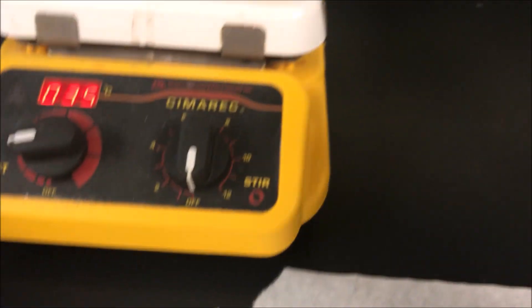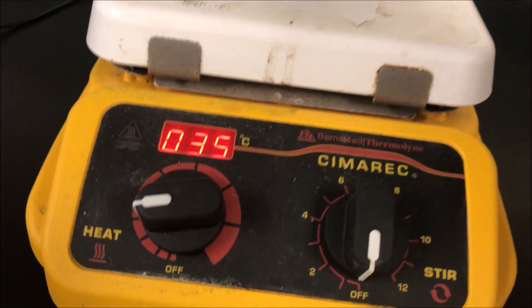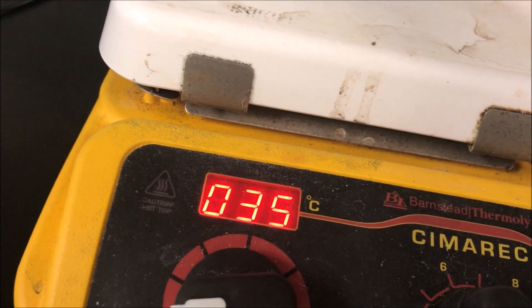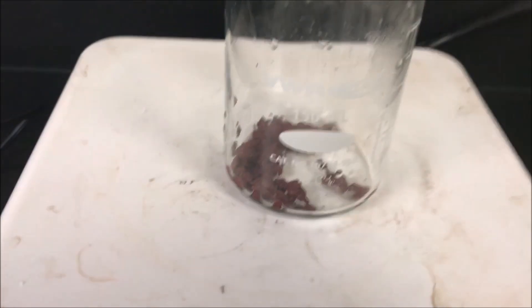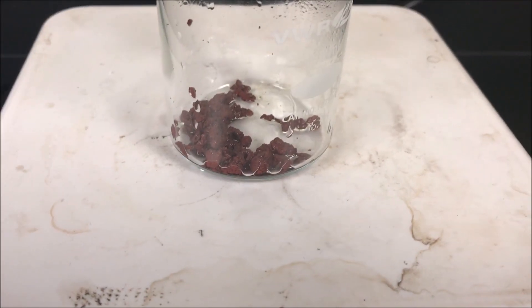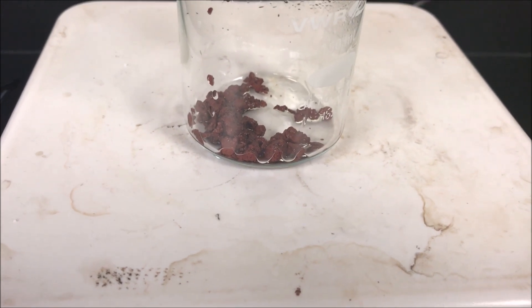Now rinse with 10 ml of methanol and after that we have to dry the sample. Heat the beaker on an electric hot plate at medium heat. Allow all the water and methanol to evaporate or dry off.